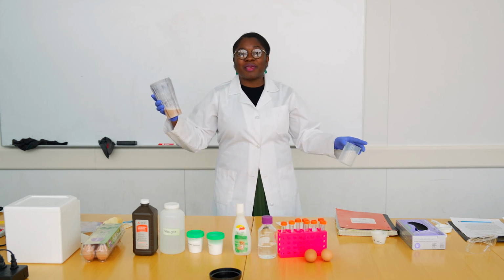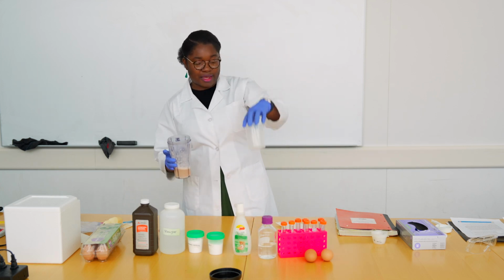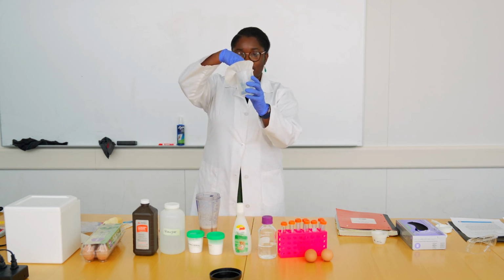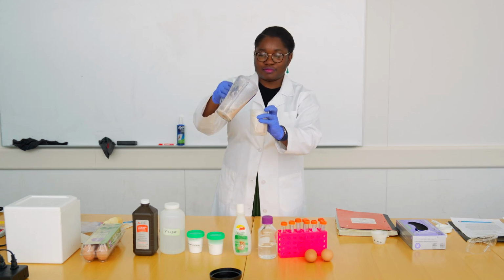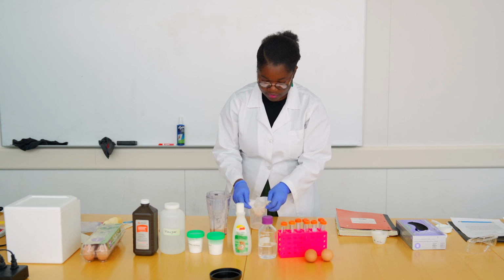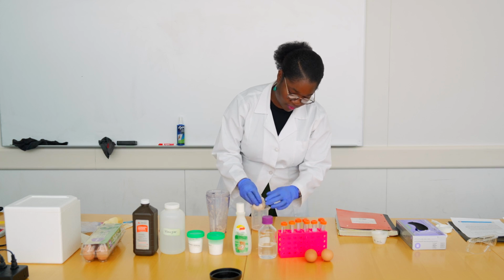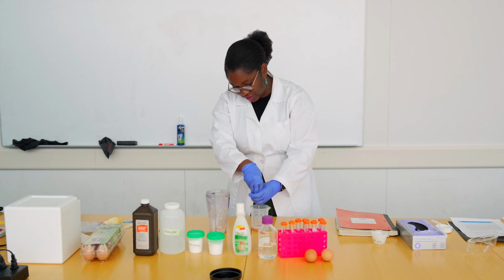And if you're making your potato juice from scratch like me, you might need a beaker, a container rather, and cheesecloth or another cloth that you could use to filter out the solid chunks from your juice. So I have my beaker and my cheesecloth, and I'll just pour my potato juice in it. There we go. Make sure you squeeze out all the chunks because it's still a little chunky.